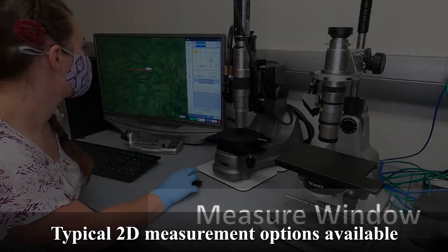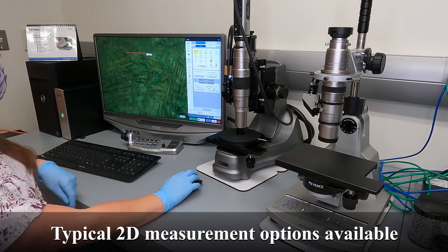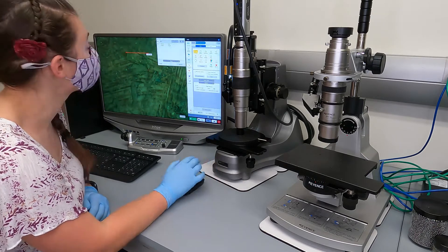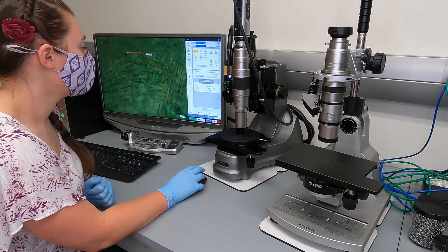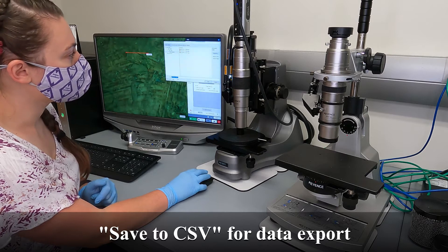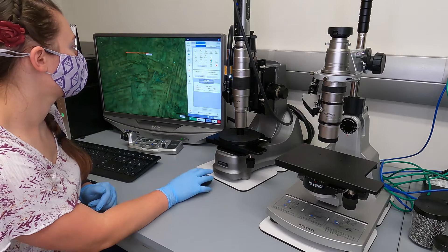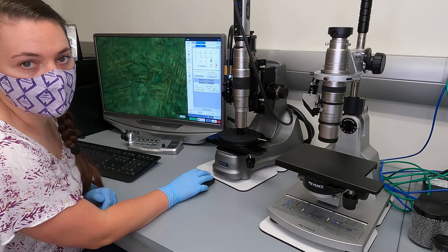You've got two points and you can drag up and down to put the number wherever you want. If you want to show the measurement result window — like it automatically popped up on the VHX600 — check the measurement result window box and it will appear. You can save that separately as a CSV, or when you hit record, you can also save the measurement CSV on the right-hand side all at once. You can delete measurements here and go back out of the measurement window.